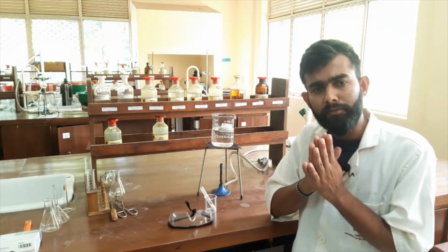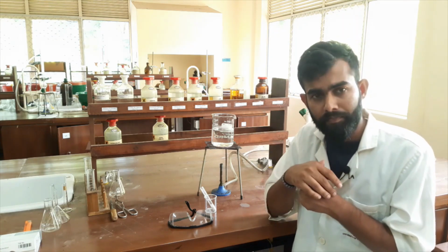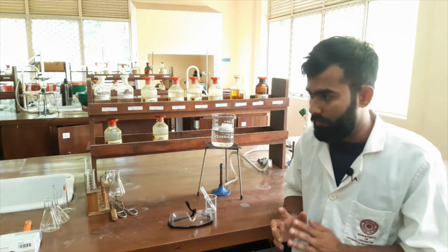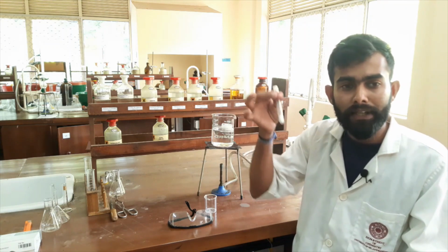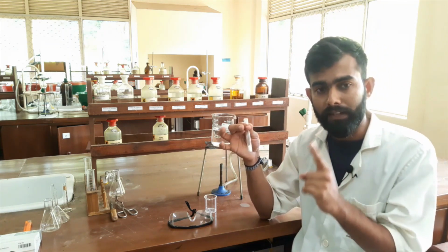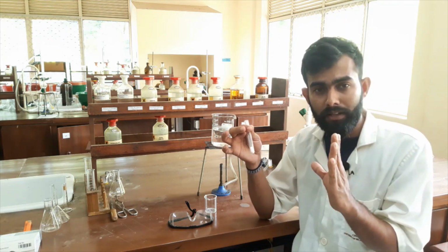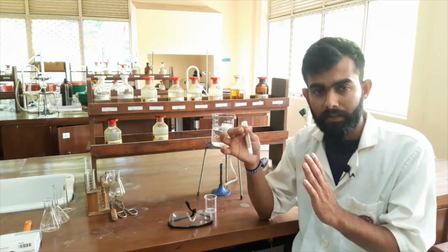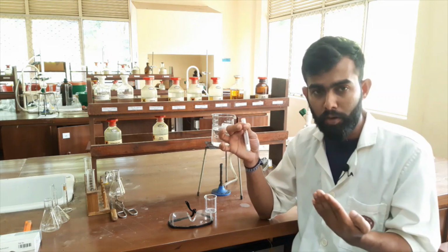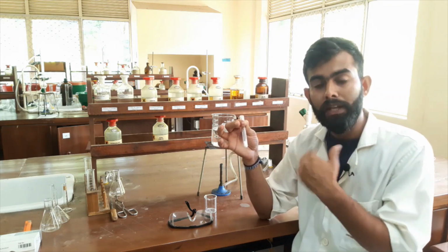What characteristic features should this particular solvent have? The major thing is, at room temperature, our solute or our chemical should not dissolve in this solvent. That's the first thing. The second thing is, when we heat the solvent, the solute should dissolve.